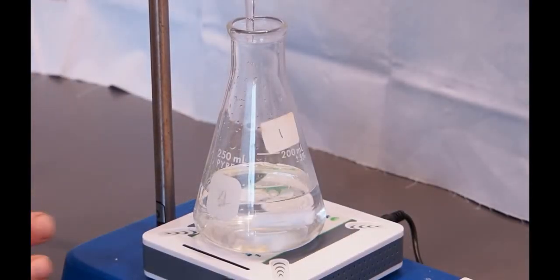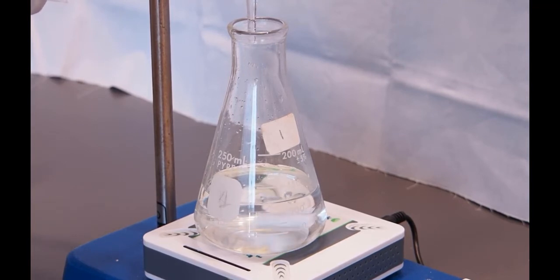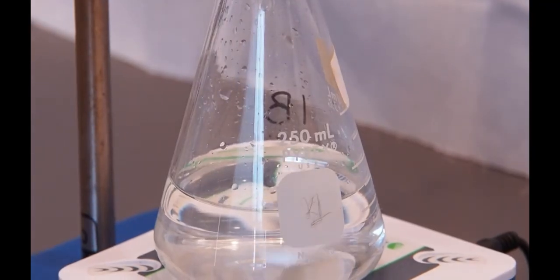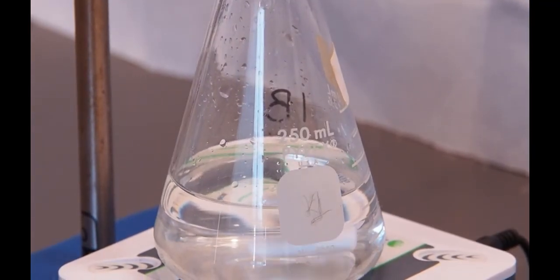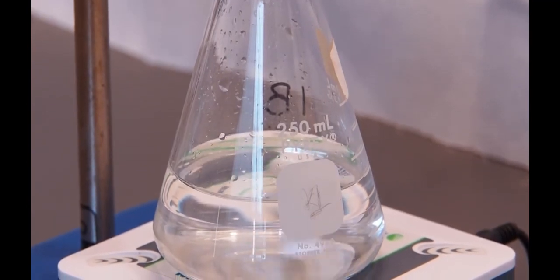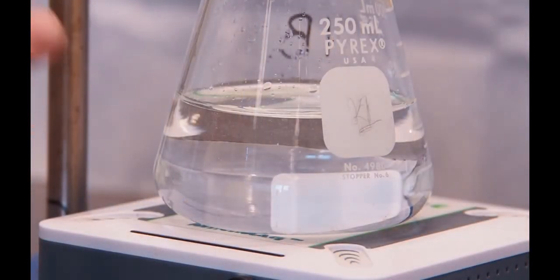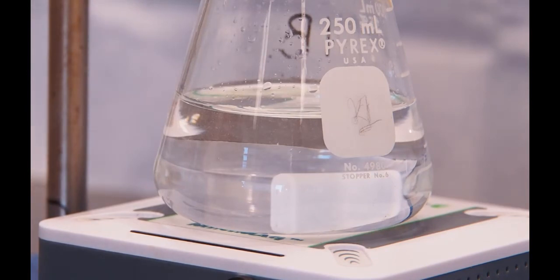Again, we're approaching the end point. So I've slowed the drop rate down to one drop at a time. I'm going to slow the rate right down to get to the very last drop. So we've got a pink solution. It's a very faint pink. And now we're going to measure the volume to see what our end point is.